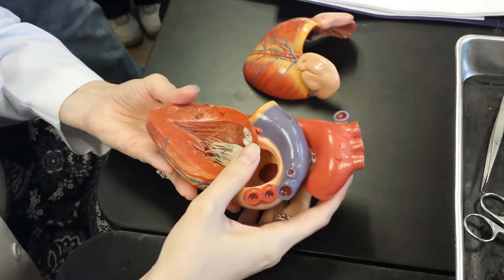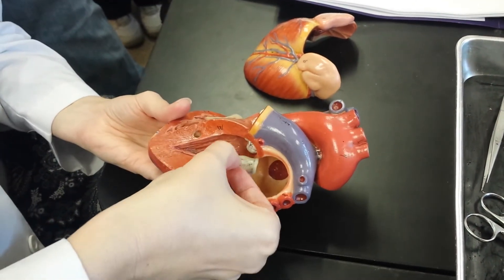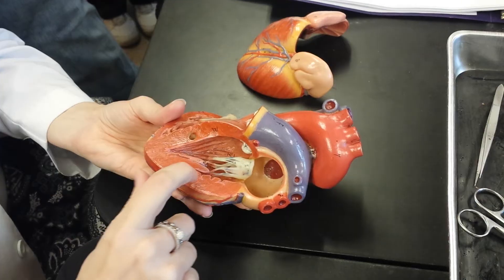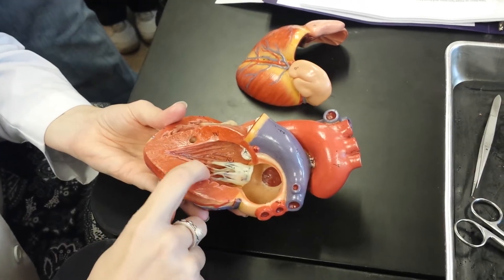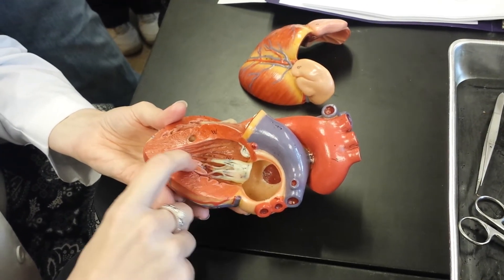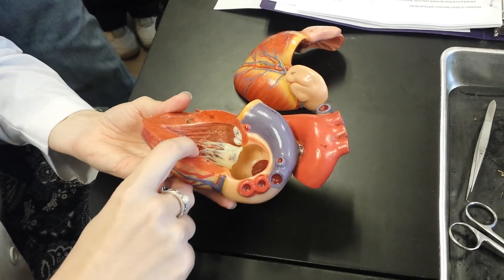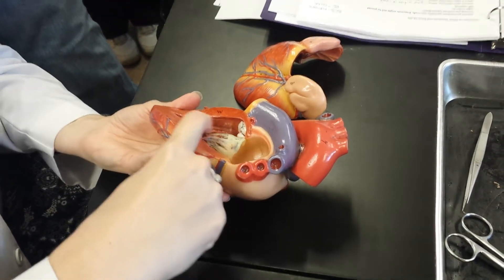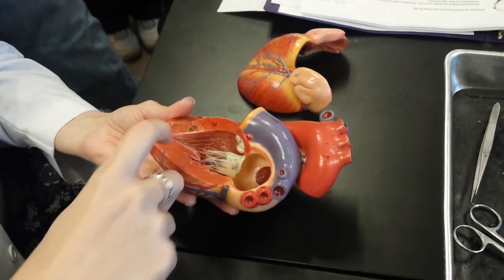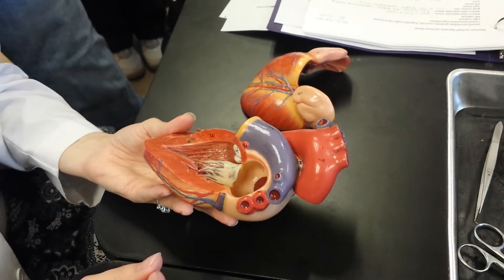You still have chordae tendineae — these little strings here. This is papillary muscle — you can see that little bump there. And you can also see the trabeculae carneae, the ridges inside the ventricles.